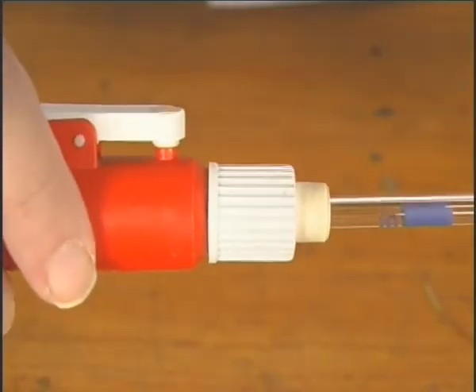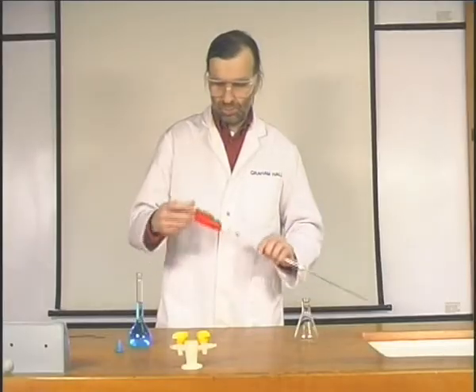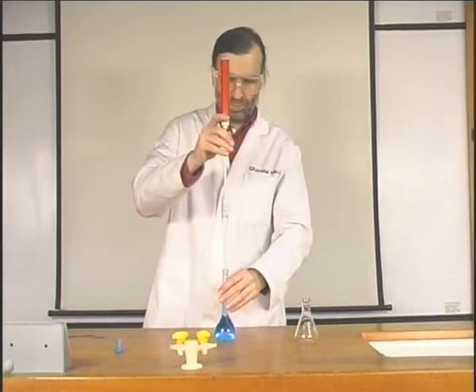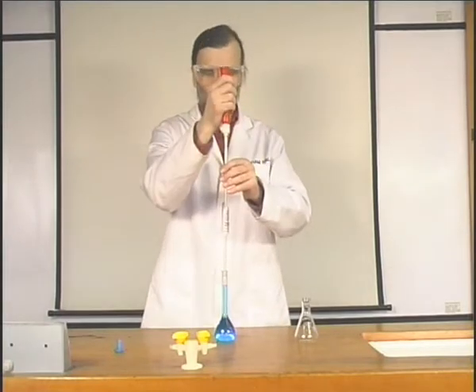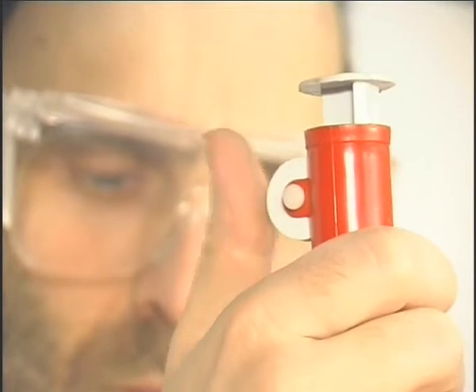The pipette filler is fitted to the pipette lightly and with a slight twist. A little liquid is sucked up into the pipette by rotating the knob.